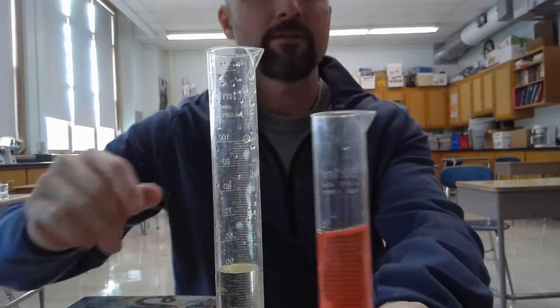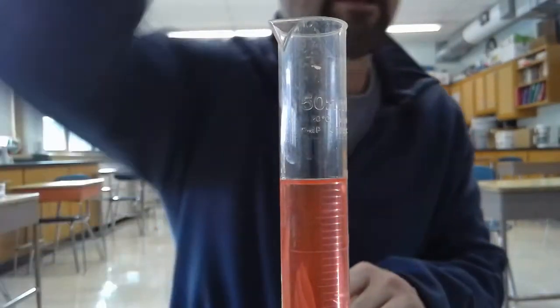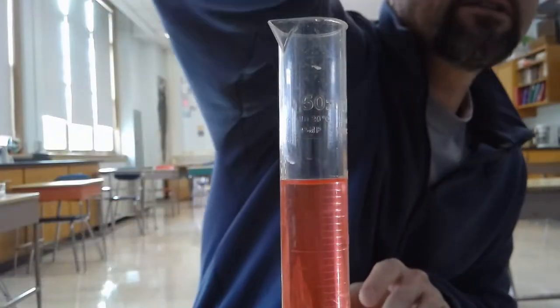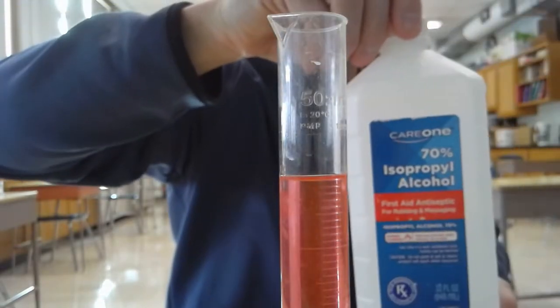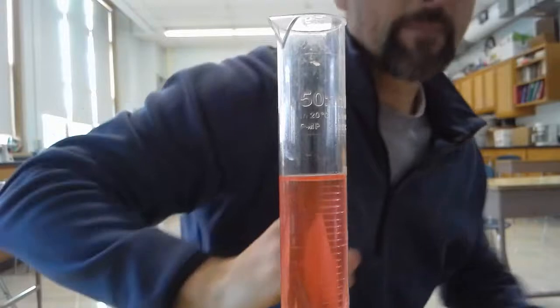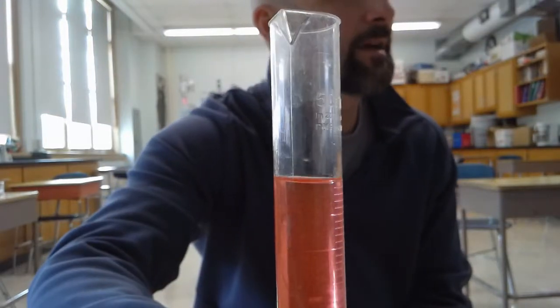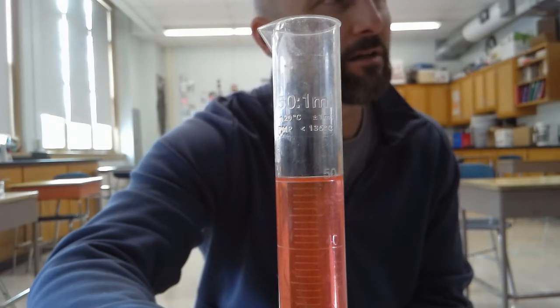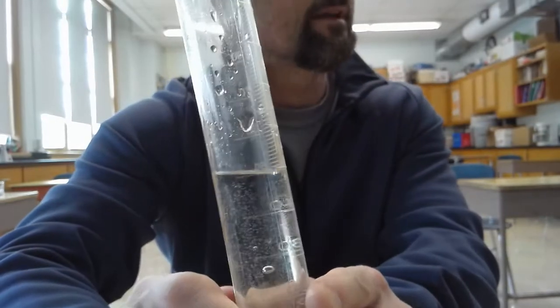What we have here to start with is 50 milliliters of alcohol. This is actually laboratory-grade alcohol — about 99 to 100% pure alcohol. If you were to do this experiment at home, you could try 91% alcohol, which you can buy at the grocery store or CVS, or 70% alcohol which you'd probably find right in your bathroom. What you'll notice is that the bottom of the meniscus is right at 50. I colored it so you can see the difference between alcohol and water — alcohol really is a clear liquid as you can tell from the container.